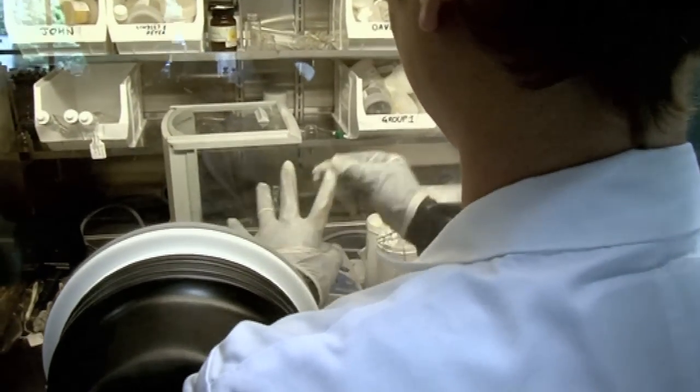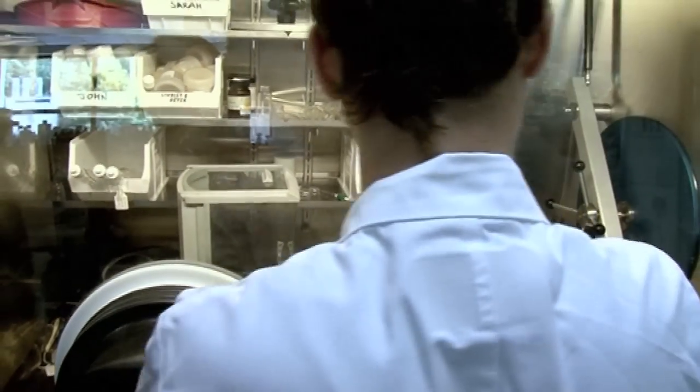Welcome to the real world of doing uranium chemistry. You have to put lots of gloves on to protect yourself.